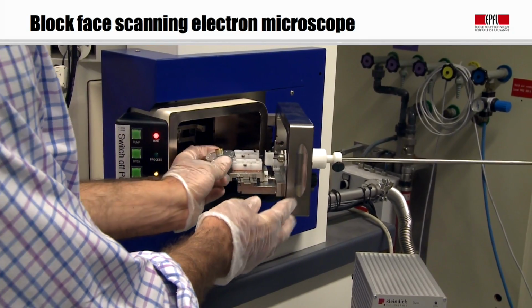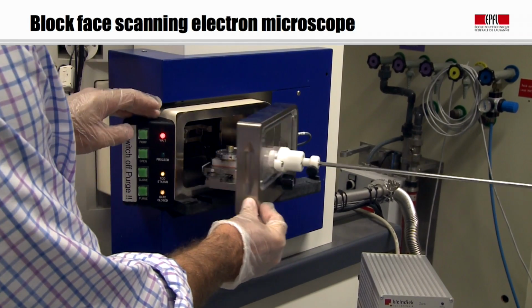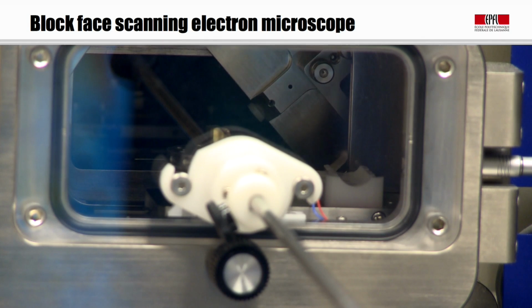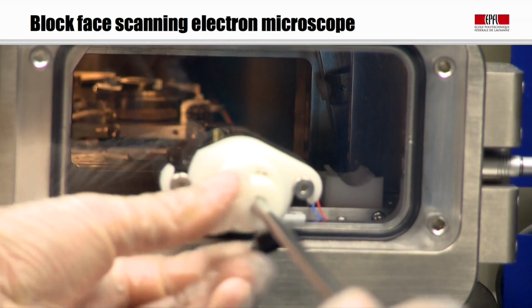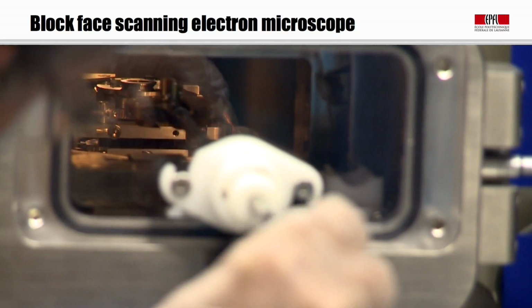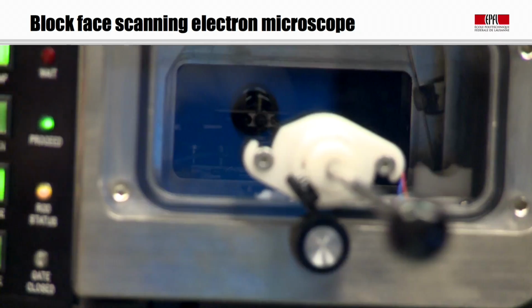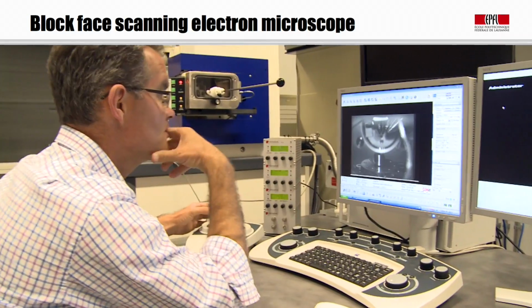You'll notice that the sample has been gold coated to improve conduction. It's then placed into the loading chamber, and when the vacuum equilibrates, the door opens and we're able to slide it in onto the main stage. We can then lock this in place and remove this loading rod, and once that's out the way, we can close the door of the main chamber and start our microscopy.